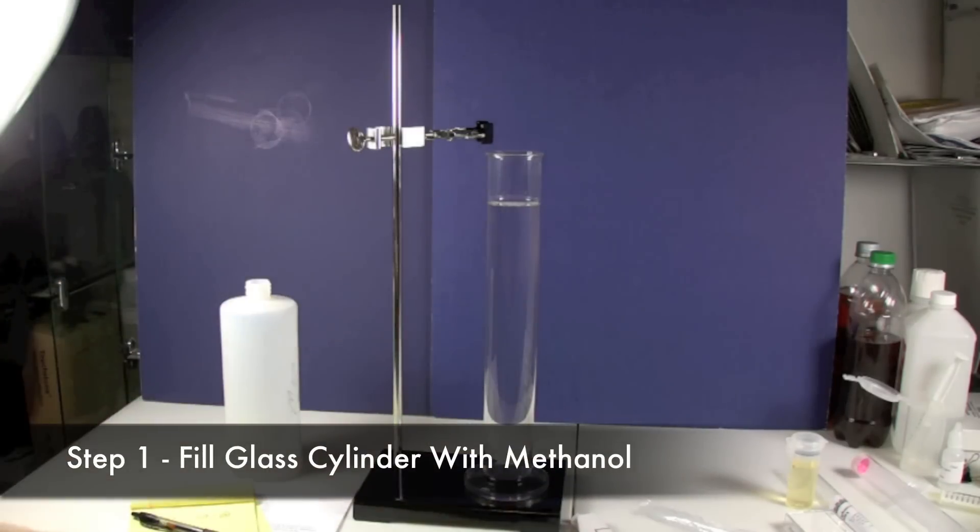First thing that we've done is we've filled this vessel about almost as full as we can get it with methanol.